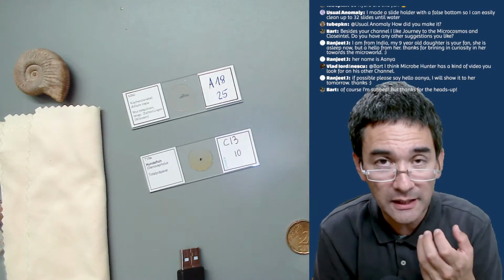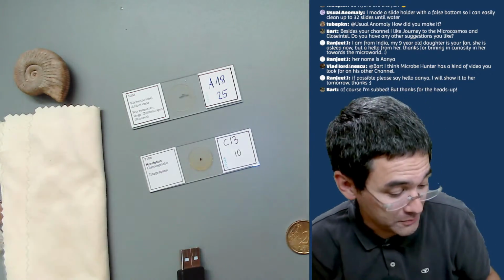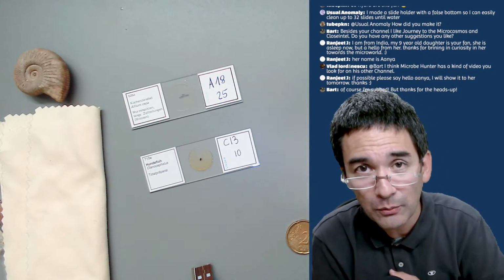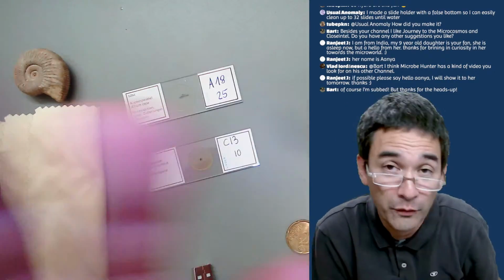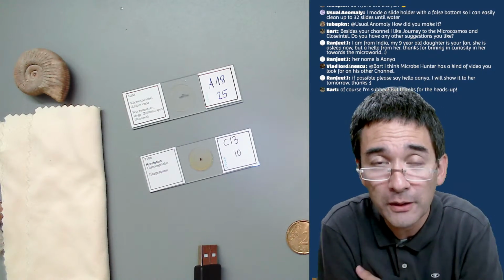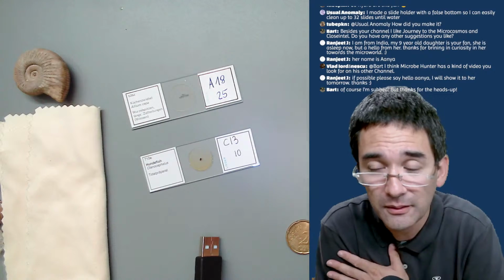So my suggestion is that if you do microscopy with children, maybe look at things of the everyday world that are not so abstract. Just put, I don't know, your fingers under the microscope and watch the dirt on the fingers. Maybe I should have shown him some more interesting things, some moving organisms, some worms or so, where there's some movement going on. So this is a recommendation if you want to do microscopy with children: pick specimens that children can identify with.